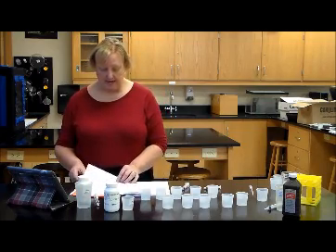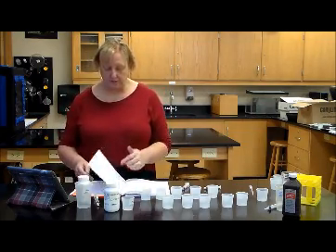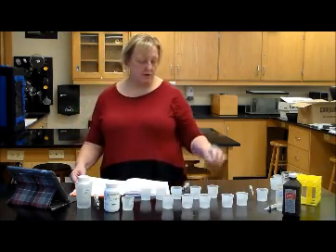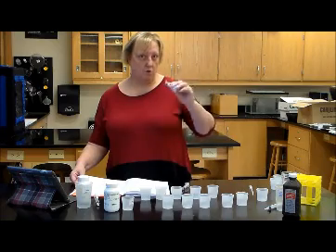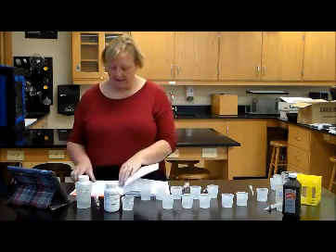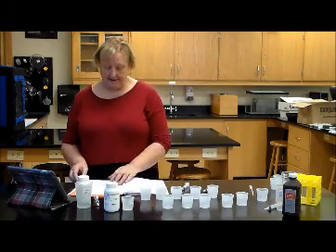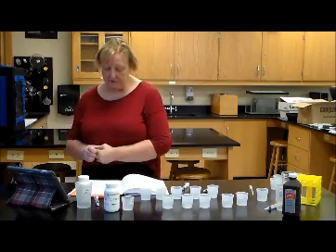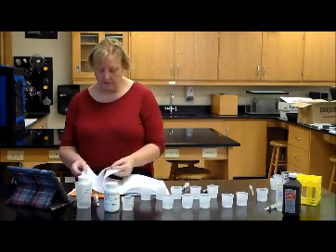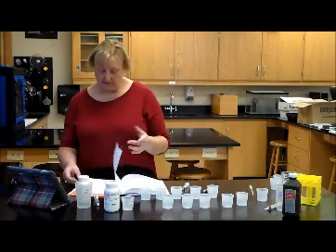It tells you how to titrate the time trials. Make sure you've read through that material, because after each transfer, you've got to wash your transfer syringe. Table 3 is data. Then you have analysis of results on pages 7 and 8.